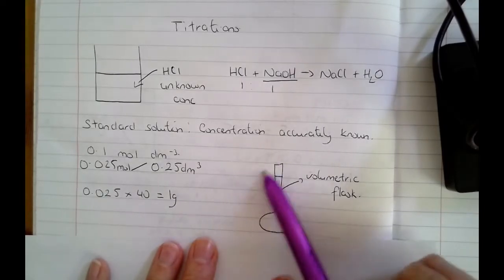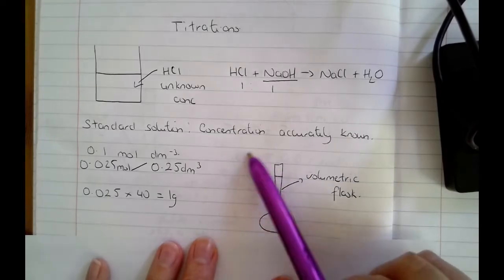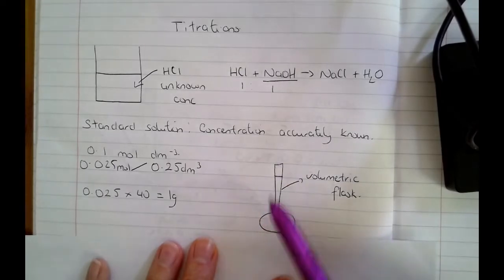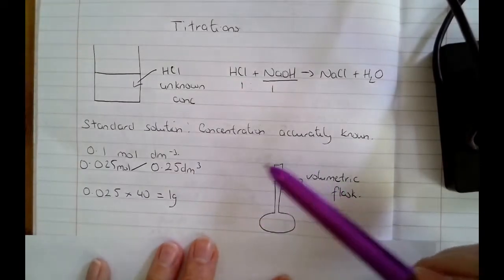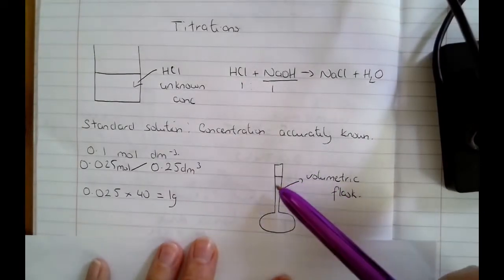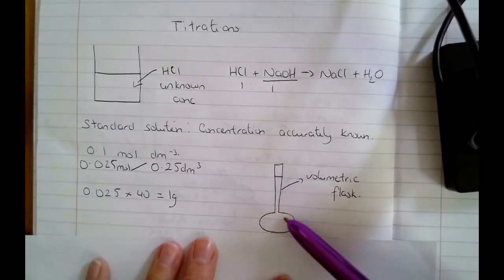So you'll weigh it out on a little weigh boat. You'll tip the solid into the flask, but then you can get a little water bottle and rinse down the weigh boat with water, and then tip the rinsings into the flask. You can also use your water bottle to rinse down the side of the flask and make sure that all of those rinsings add to the bottom.